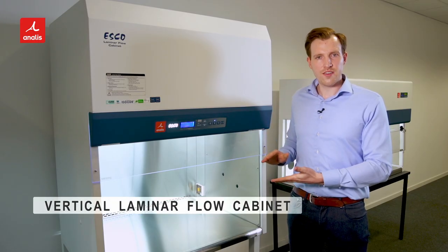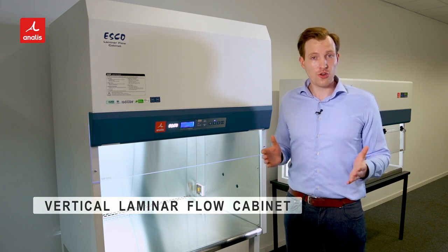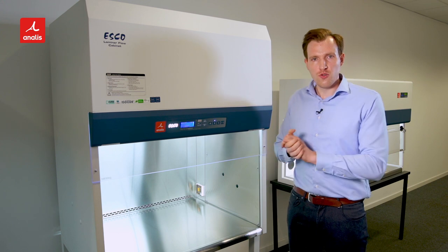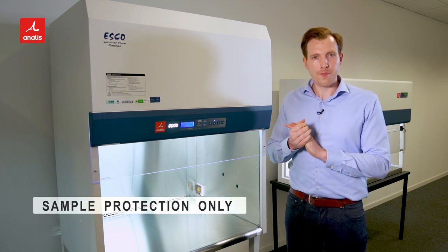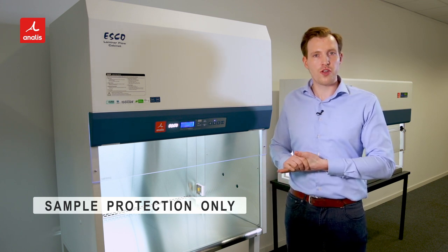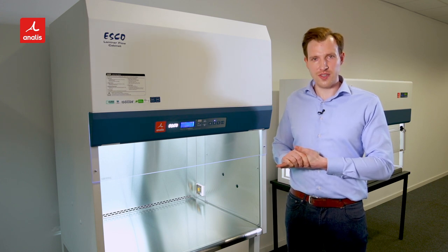This is a vertical laminar flow cabinet. It is a laboratory workstation that provides protection of your experiment through HEPA filtered downflow air. Please keep in mind that this cabinet is not suitable for experiments working with hazardous products. Another type of cabinet should be used for these applications.